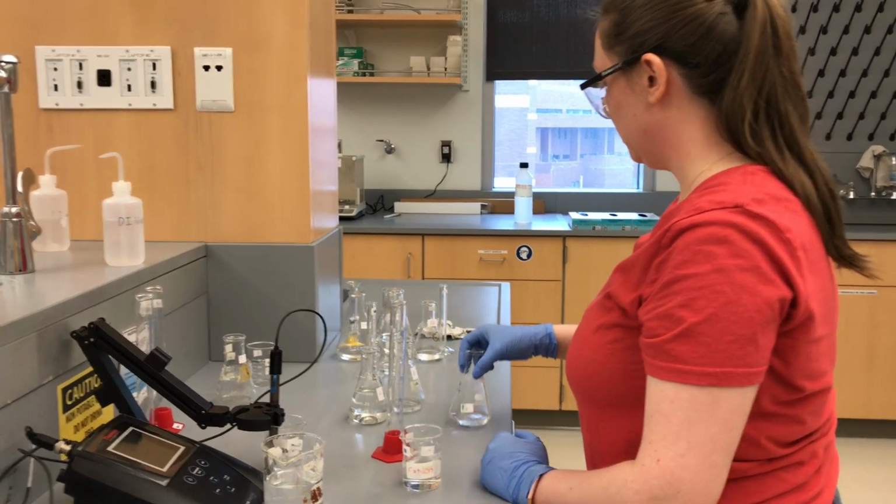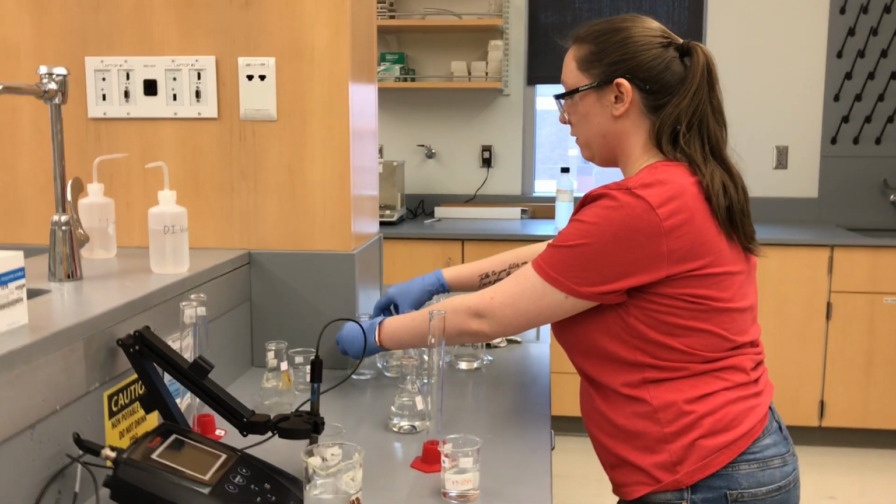Alright, so our 40 mils of F, we're done with HCl now.